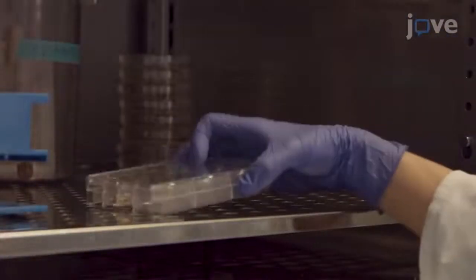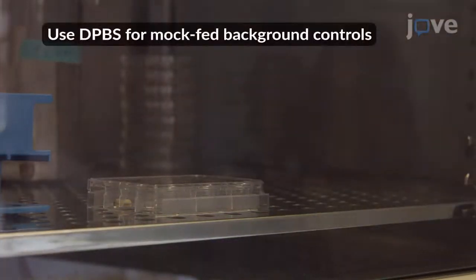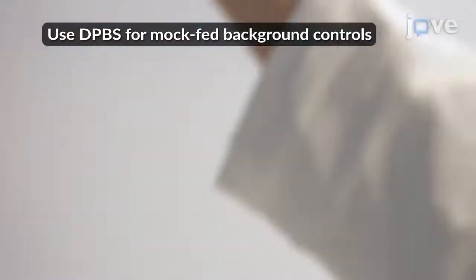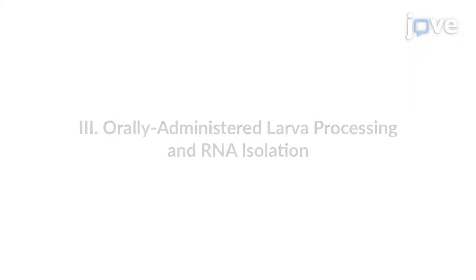When all of the larvae have been fed, incubate the animals in the dark at 37 degrees Celsius between 1 to 24 hours. For larva processing, clean a safety hood.